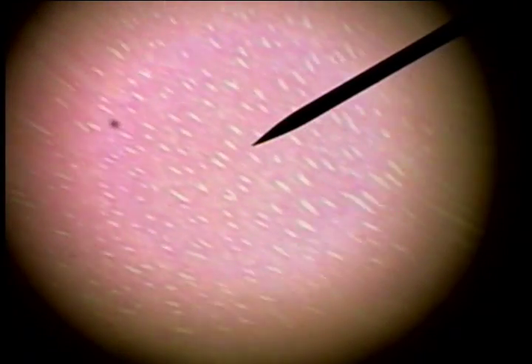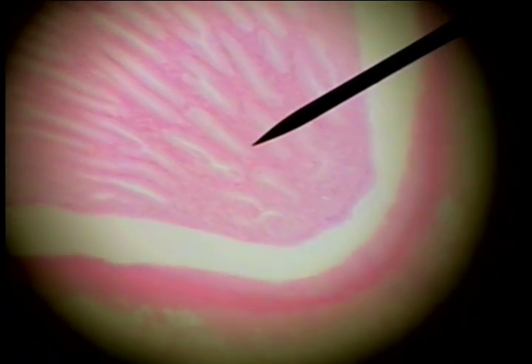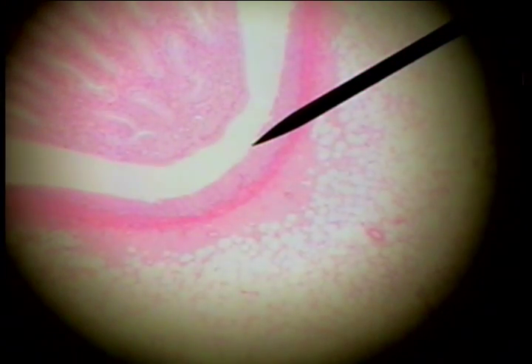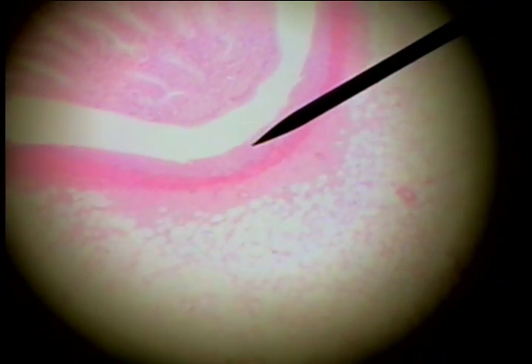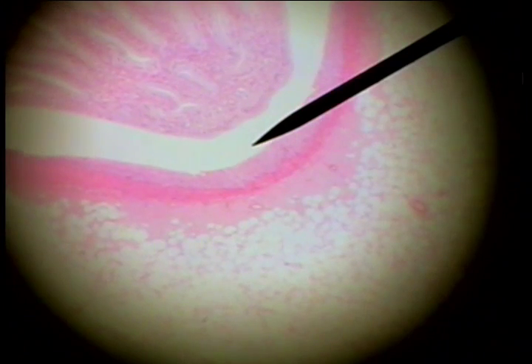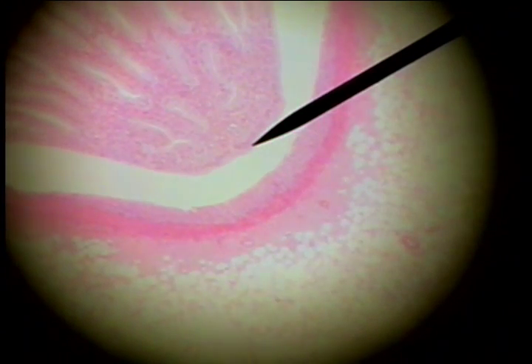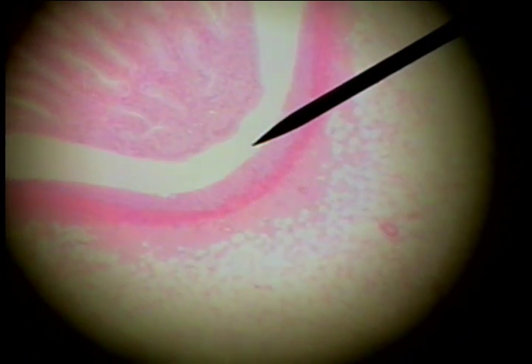As we scan toward the deep surface, this is the lighter medulla of the kidney. The medulla ends at the tip of a pyramid, and this structure here is a funnel-shaped calyx which collects the urine that's released from the tip of the pyramid.